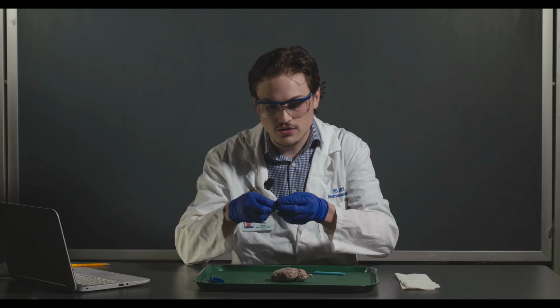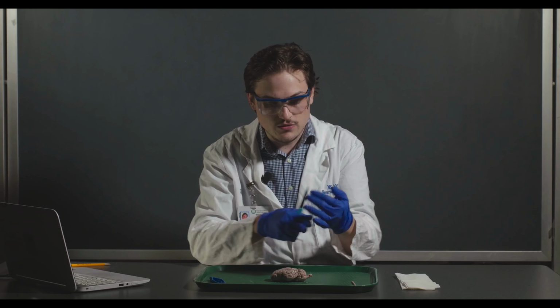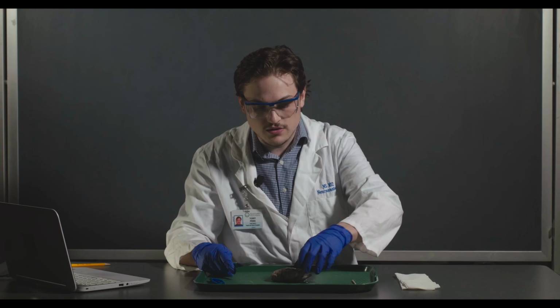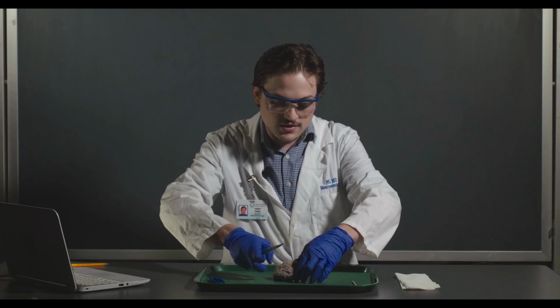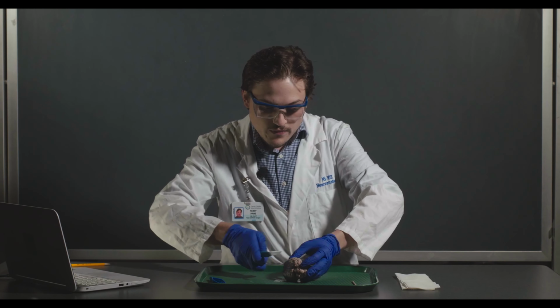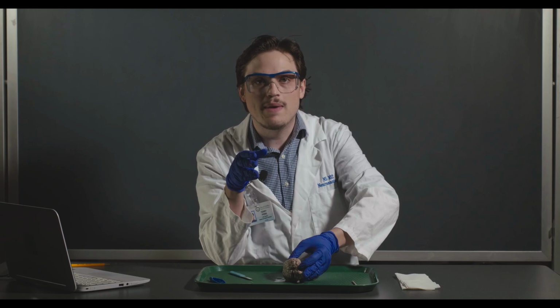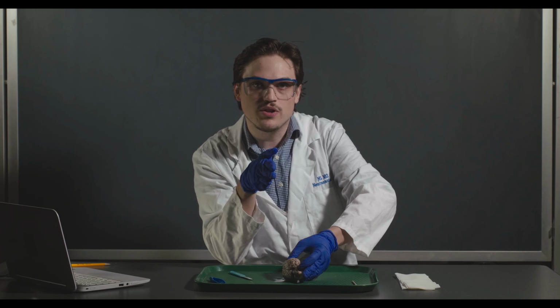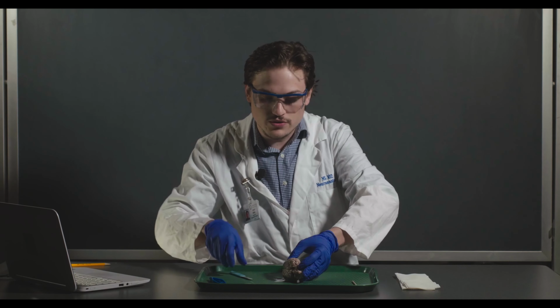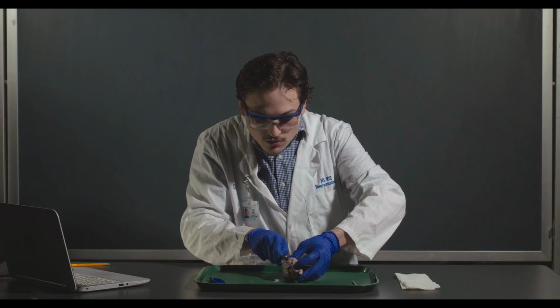So the first thing you're going to do, you can follow along in your lab manual, is we're going to essentially make cuts from the dorsal surface, and we're going to make axial cuts. So we're going to essentially cut like this and keep cutting down until we start to get to where the white matter, again, those axons kind of start to fan out into a sheet. That means we're getting really close to the lateral ventricles. So I'm going to go ahead and start shaving off parts of the cortex.